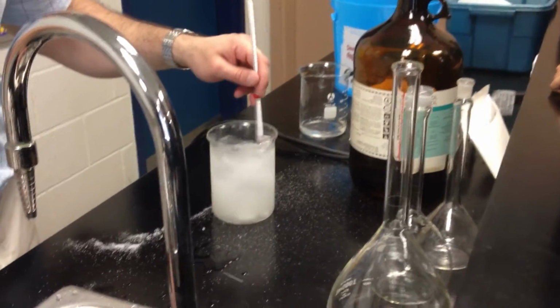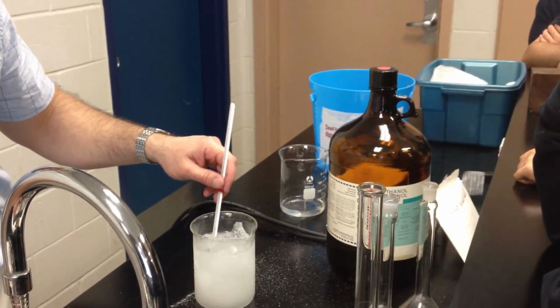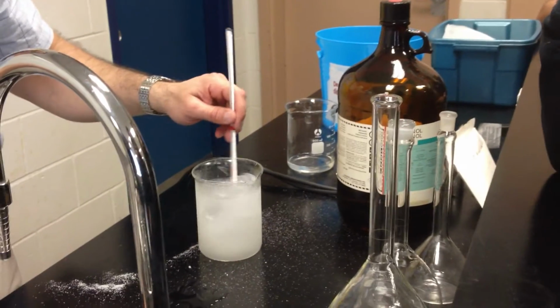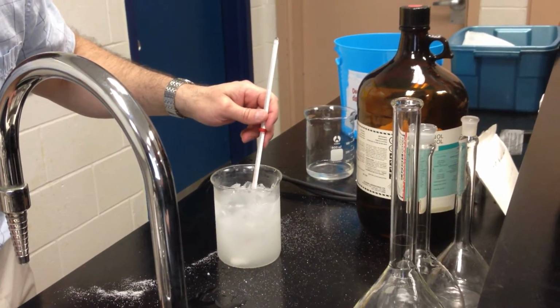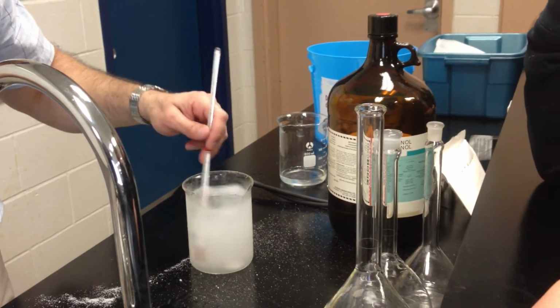And the same amount of energy is released if something in the gas phase turns into a liquid, except now the energy flow is in the opposite direction. So when steam condenses into water, it releases all the heat energy that it was carrying. You see the temperature has now gotten to minus 7.5. And it would continue to drop to about minus 11.